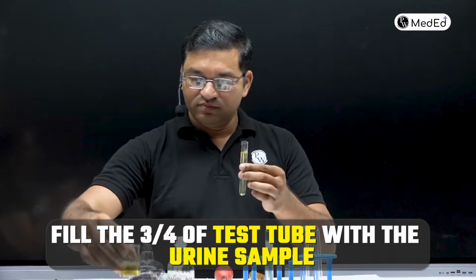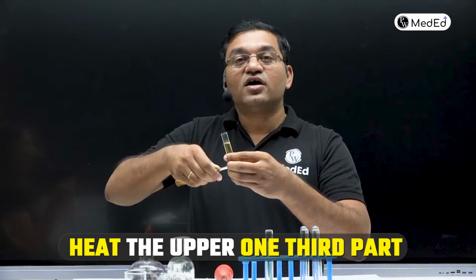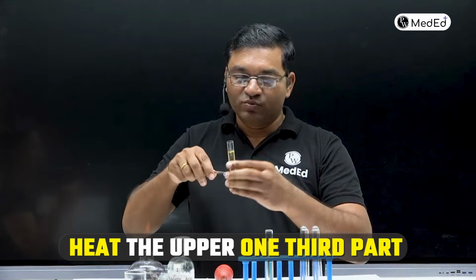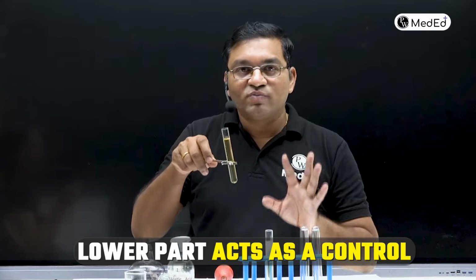Okay. Now apply the test tube holder and heat the upper 1/3 part of the test tube, only the upper 1/3 part. Got it? Lower part of the test tube acts as a control.